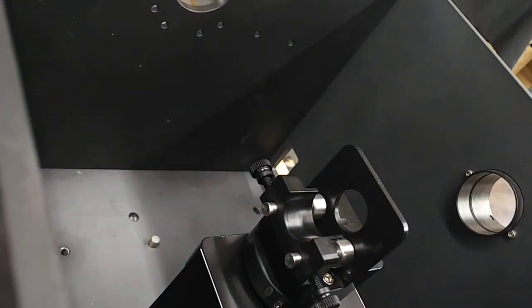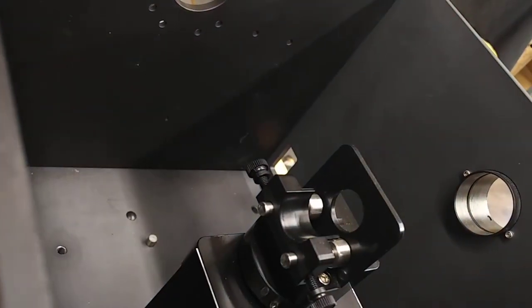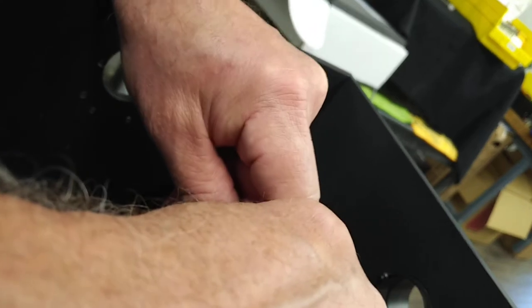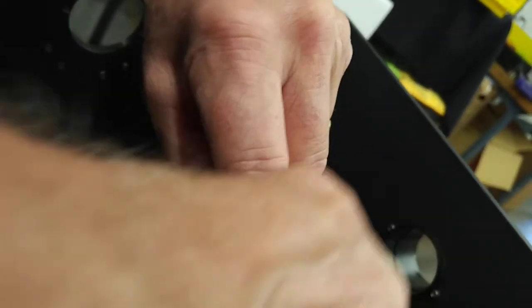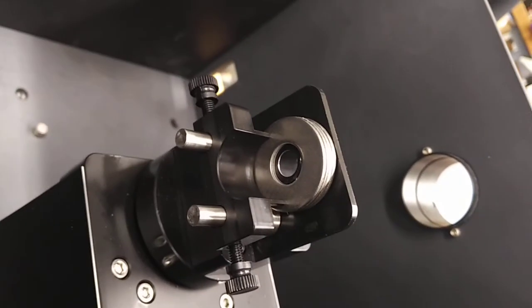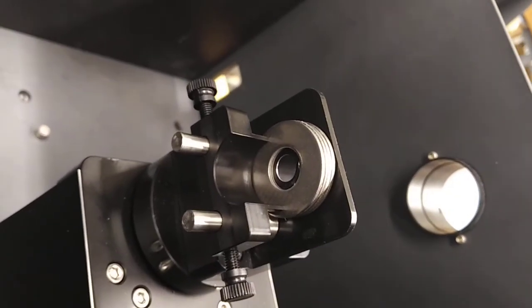Okay, lifting that out now and putting in a very small filter that's in a holder to accommodate it. And there we have that.